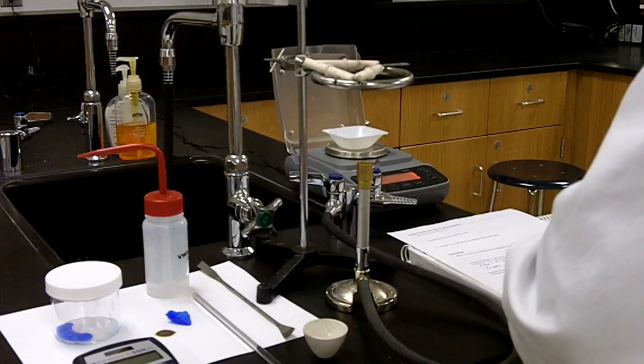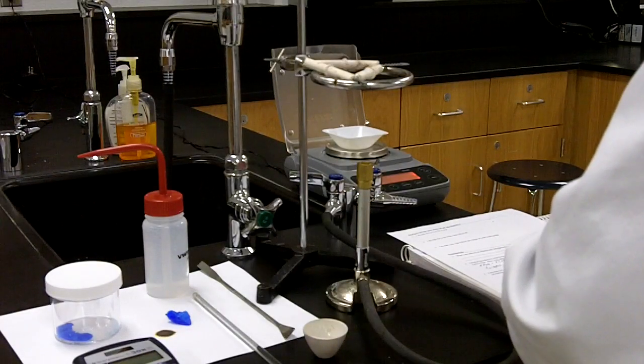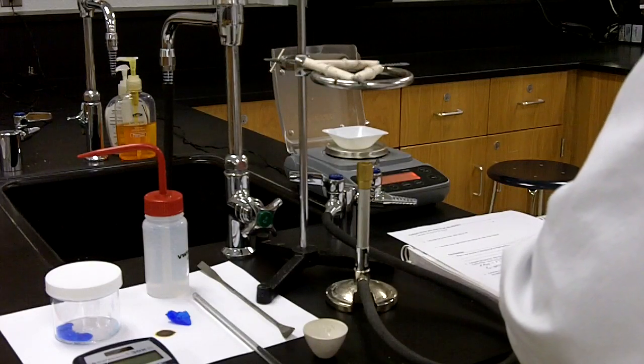And I get 36%. So at least theoretically, my theoretical yield for the water, or the amount of water theoretically that I should get, will be 36%.